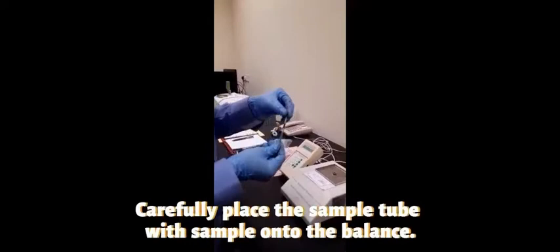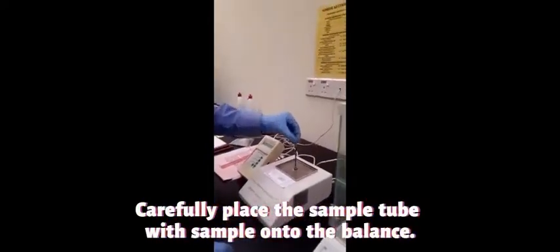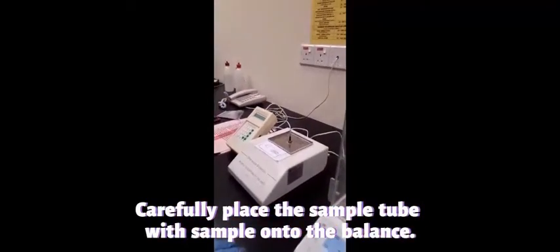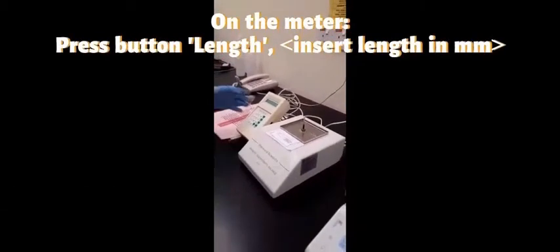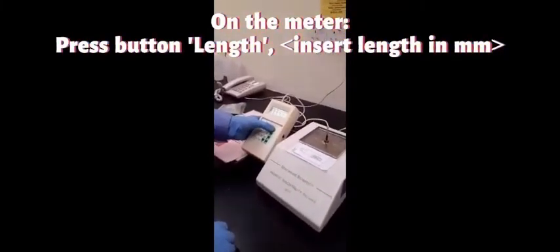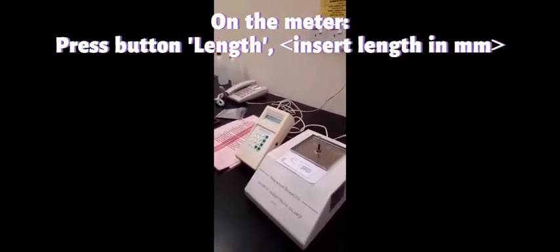Now put the sample tube into the balance. We press length, and when we press length, the height of the sample is 37 millimeter.